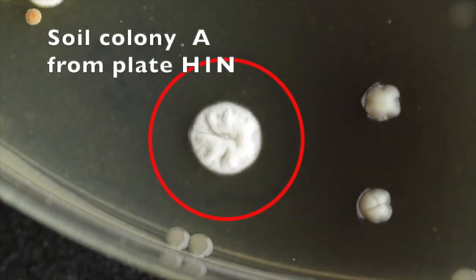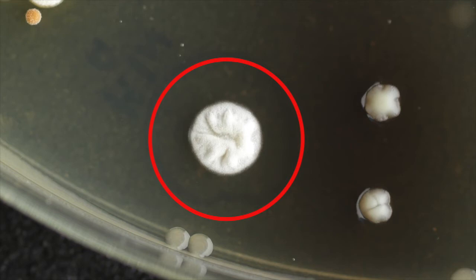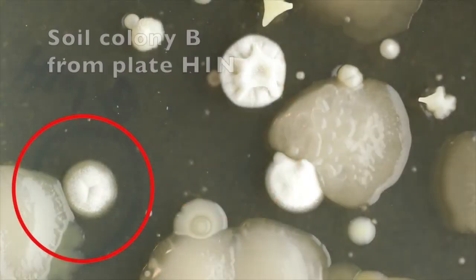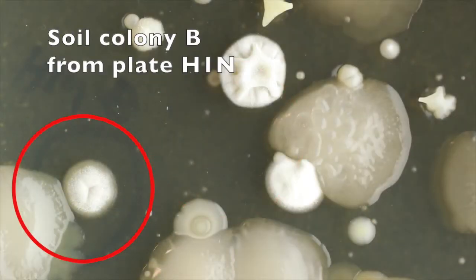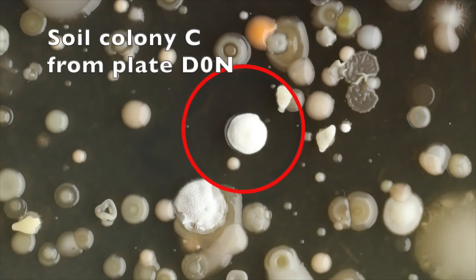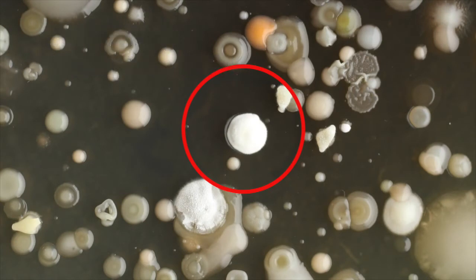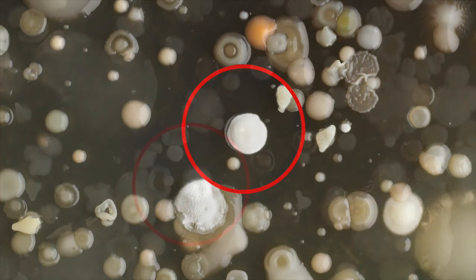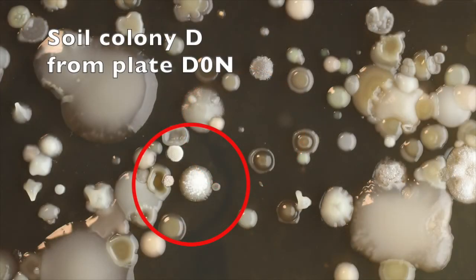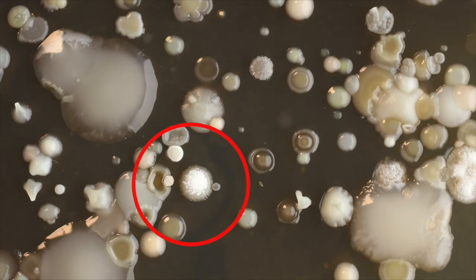Soil isolate A came from sample H diluted 10 to the minus 1. Soil isolate B also came from sample H diluted at 10 to the minus 1. Soil isolate C came from sample D plated undiluted, and soil isolate D also came from the same plate. All soil isolates were chosen from plates containing nalidixic acid.